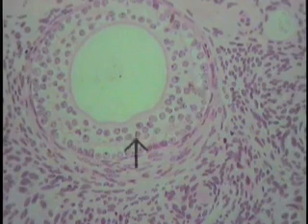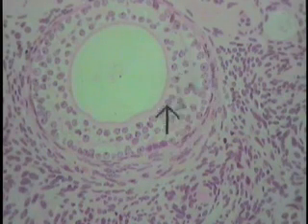Having made those observations, move the field on your particular section and look at yet smaller cells. This band of structures indicated by the pointer is a collection of several cells. Nonetheless, the nuclei can be made out quite clearly, as well as on occasion the nucleolus, as shown here or perhaps here and here. Find a field similar to this one and examine it in detail.